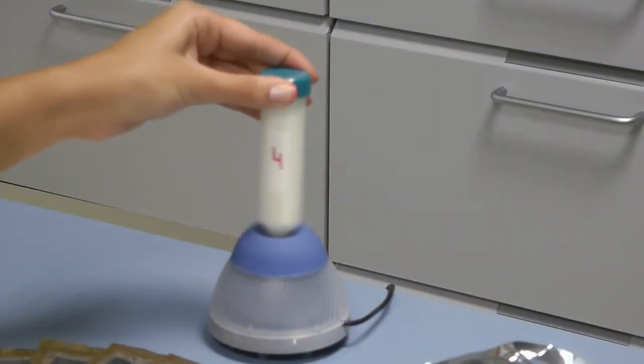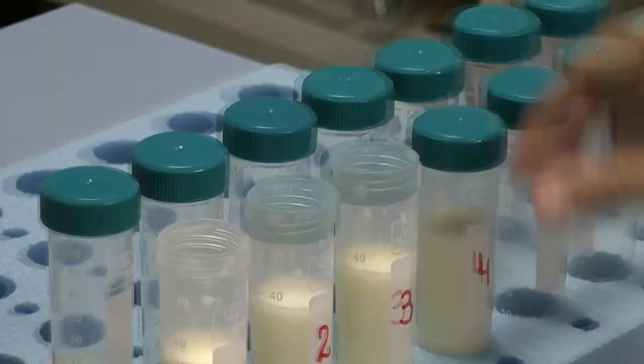Repeat the procedure with all the samples. When finished, open the sample caps.